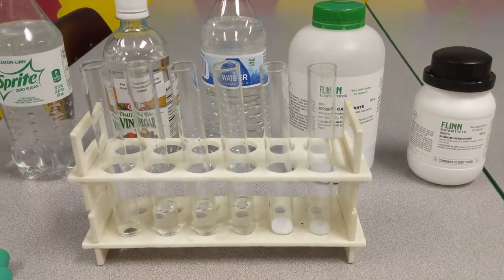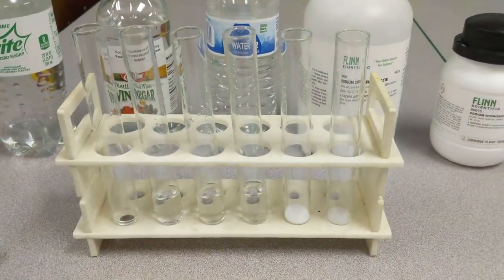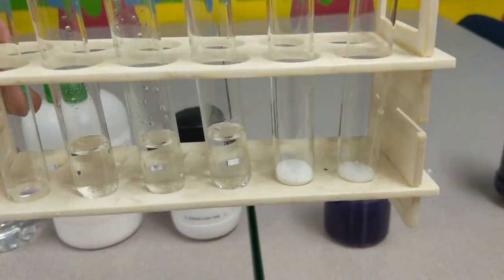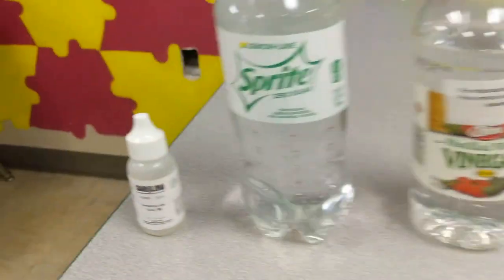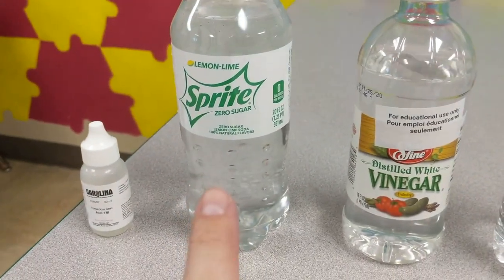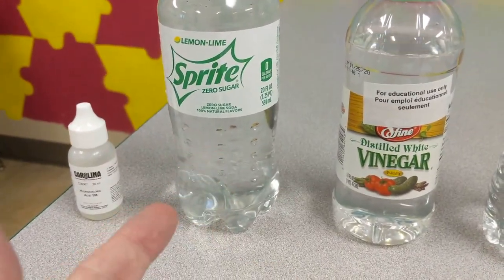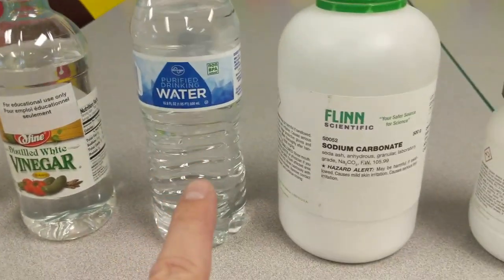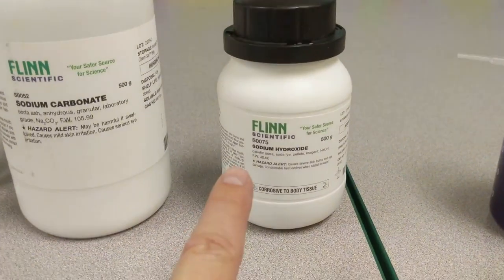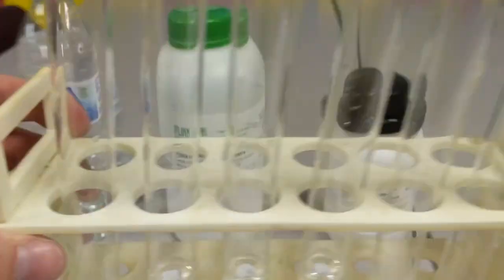Now we're back. I've put in these test tubes a variety of substances with a variety of pHs. I've put hydrochloric acid, some soda — soda usually has a relatively low pH, and I chose Sprite because it's clear — then distilled white vinegar, drinking water, sodium carbonate, and also a really strong base, sodium hydroxide.